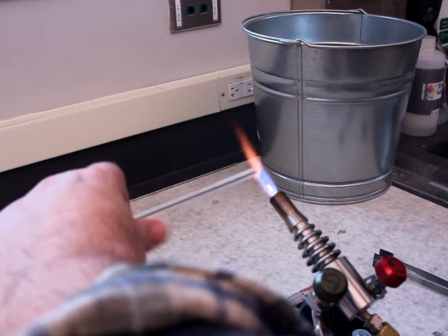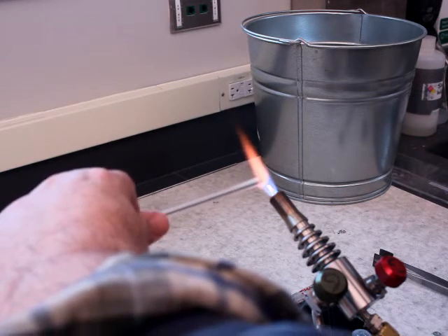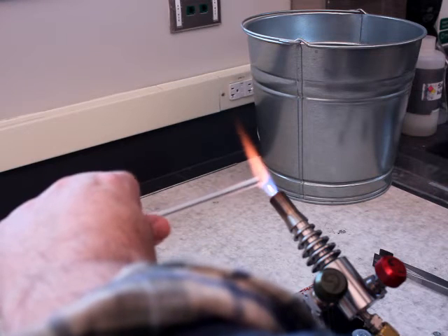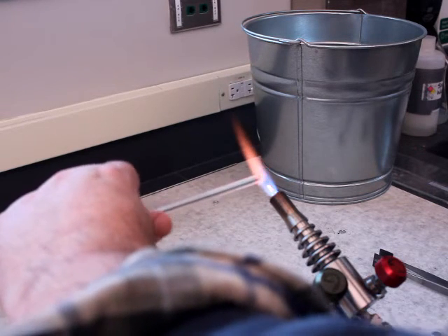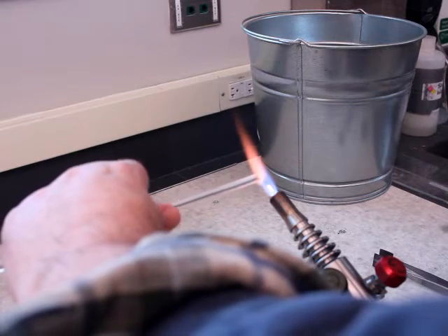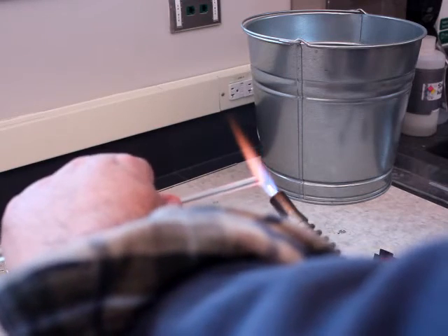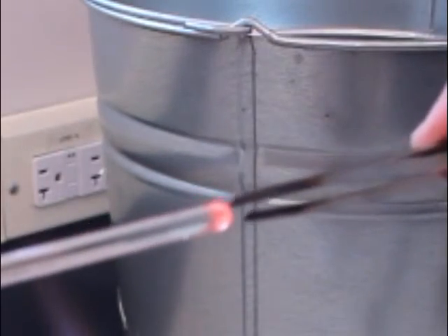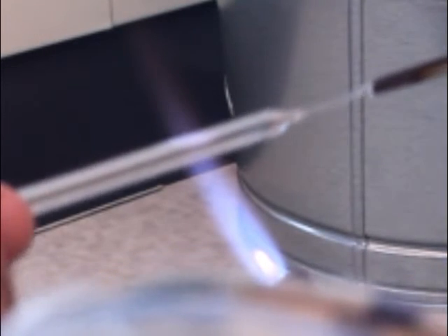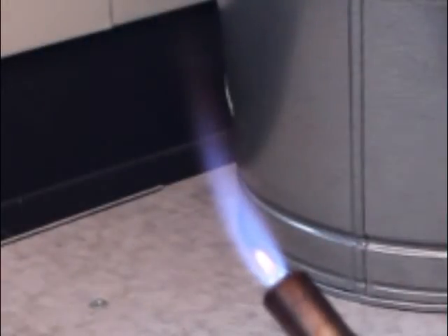If the glass is not hot enough when I pinch it, it will not move. If I get too much glass heated up it'll be awkward, because when I pull on it it might deform in one direction or another. You can see there are some hot spots — parts of the glass that glow at different colors — those are impurities. Now I come out, pinch, give it a little pull, go back in the flame, and then throw that away and switch hands.